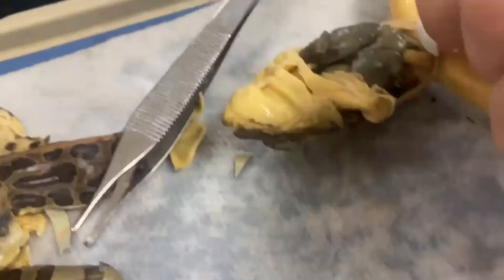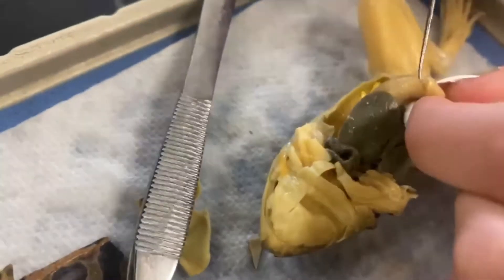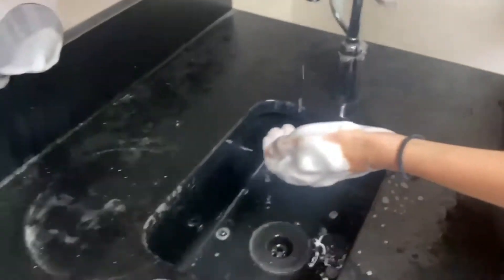Empty. Yep, our stomach's empty. All right, good job. Good job. I'm not touching your hand until you wash it. It's time to say final goodbyes. Rest in peace. Time to wash up.